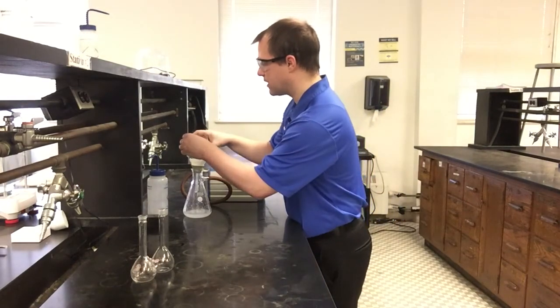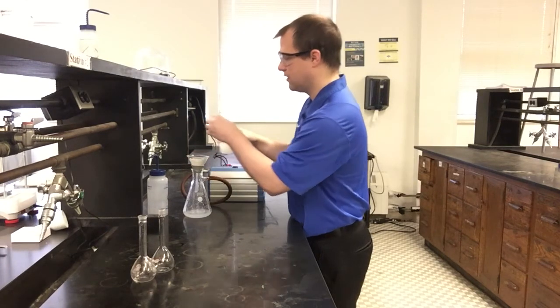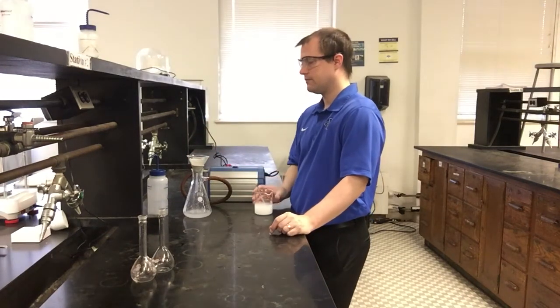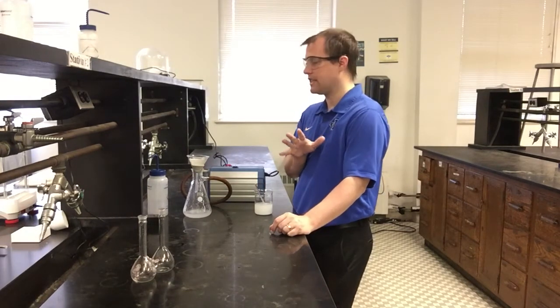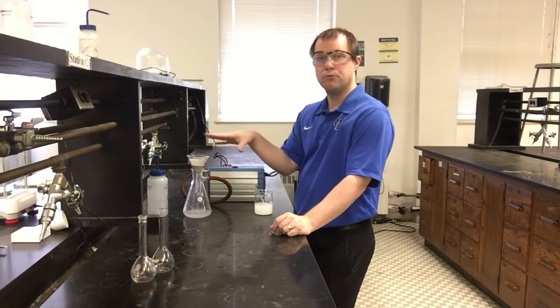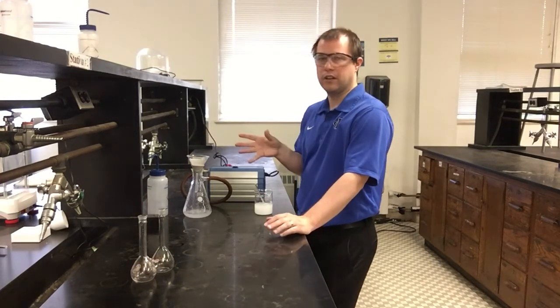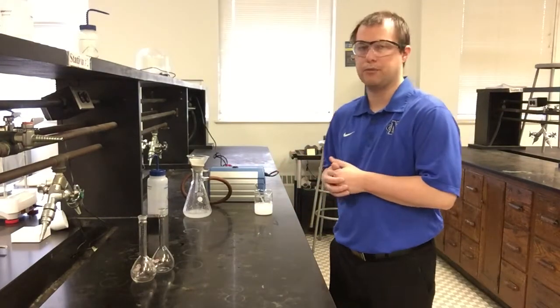So it looks like most of my liquid's drained through, so I'm going to keep adding. You can still hear it pulling on everything. I'm going to cut the video here for a second, and I'll come back to it towards the end and give you a zoomed-in picture from above of what's going on as I get to the very end, where you can see the solid that's building up in the filter paper itself.